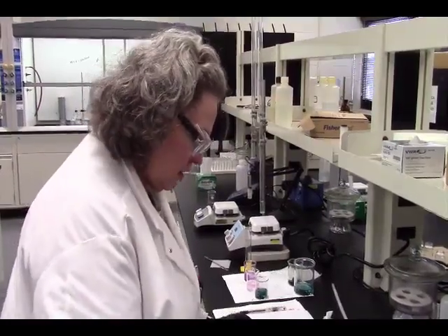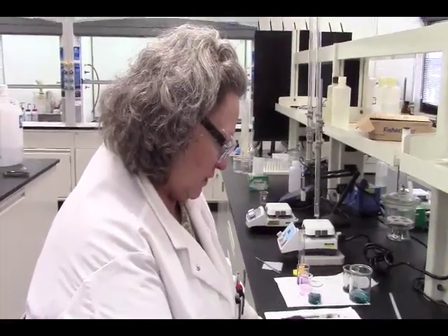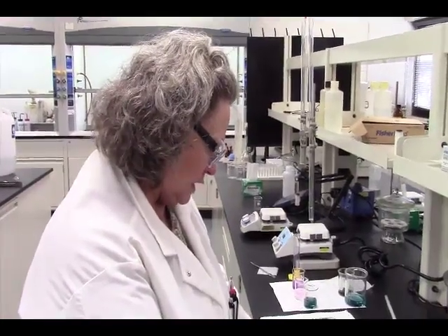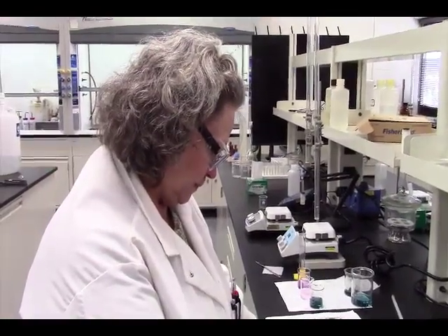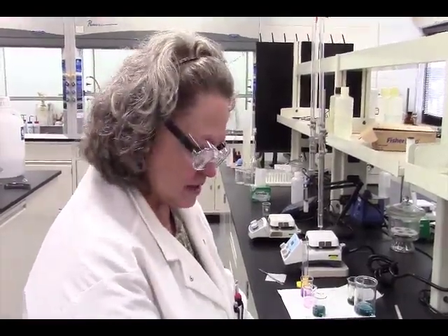Then we are not going to be making the cyanide complex, but we will use our cobaltous chloride complex. The reason we're not making the cyanide complex is, if you guys were here, potassium cyanide is way dangerous, and I would rather you not handle that, because it even says on the bottle that contact with skin will cause or may cause death. So yeah, it's something we really don't want to mess with.